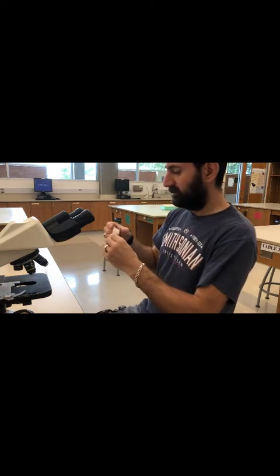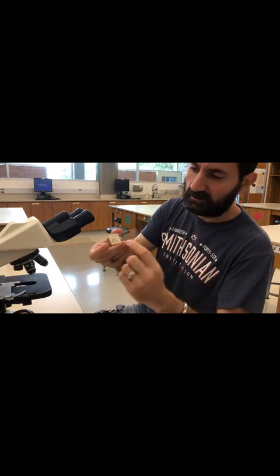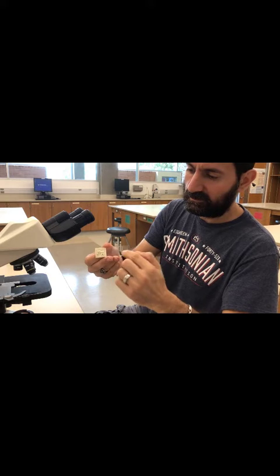Go ahead and retrieve your specimen. This is a prepared slide. Notice that there's already a label on there and a cover slip.